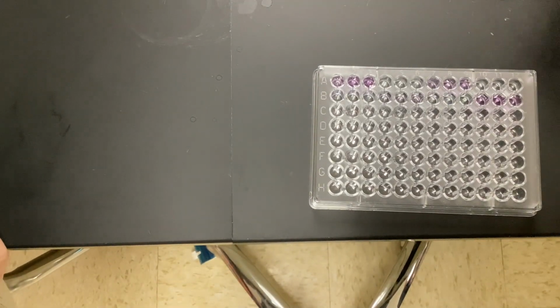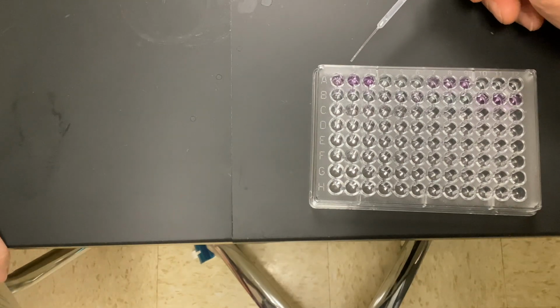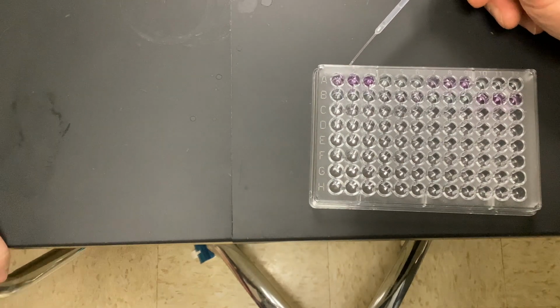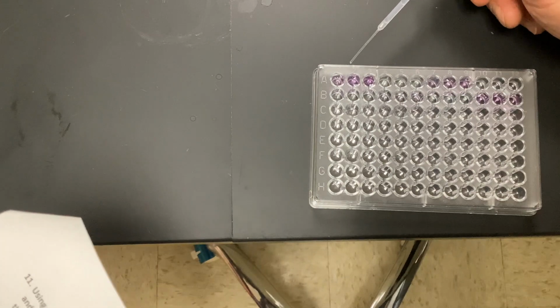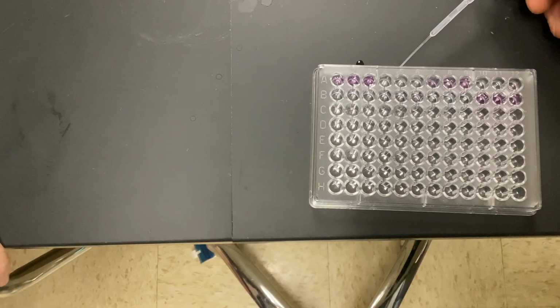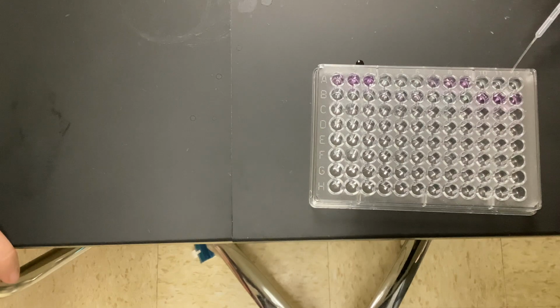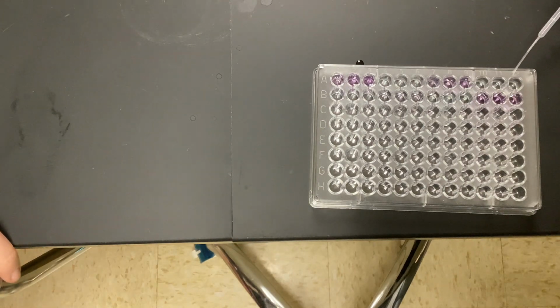All right, so that's our positive right here. That's giving us our positive. We know that that's antigen-antibody reaction; that is our indicator. This is our negative, and we can say that's negative. All right, so this is patient A. Can everyone agree it's slightly purple? What about patient B, all three wells? I don't see any reaction.